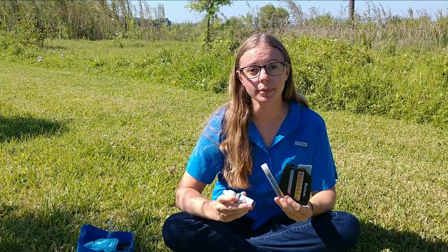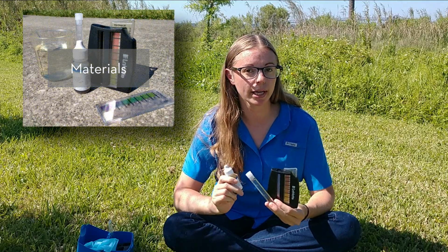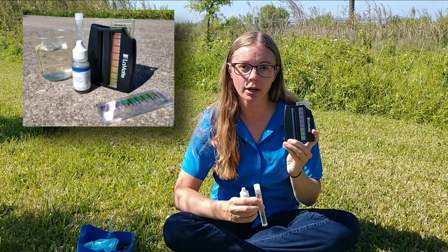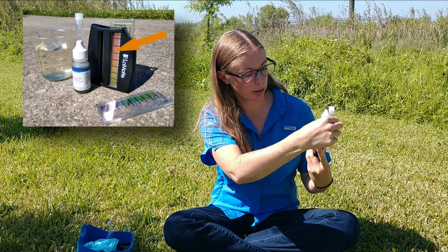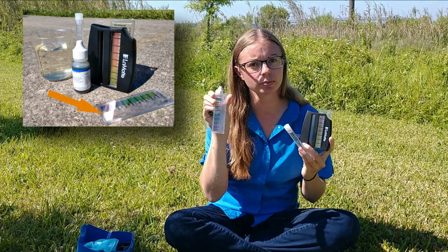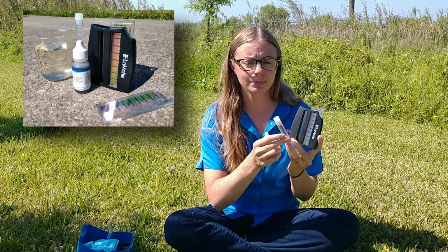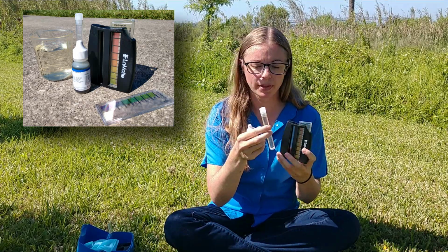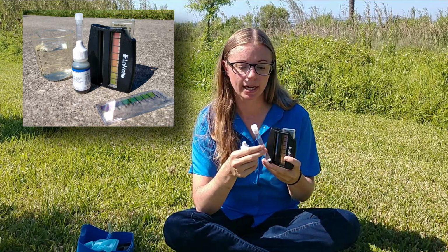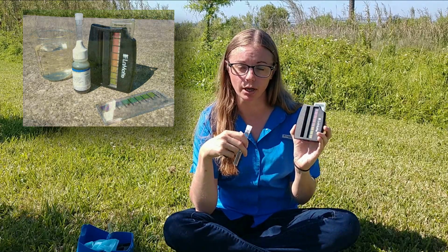So now we're going to test the pH levels of our St. Johns River. I'm using a LaMotte wide range pH test, and what that includes is a color comparator. So this scale goes from 3 to 6.5, and then I have another scale that goes from 7 to 10. I have a reagent that I'm going to add to my river sample in my little vial here, and this reagent will bind with the hydrogen ions, and it'll form a color, and then I'll use it to compare it to the colors on the color comparator.